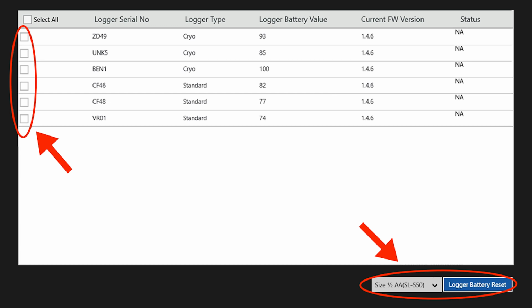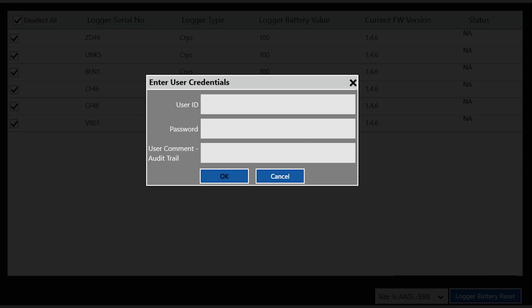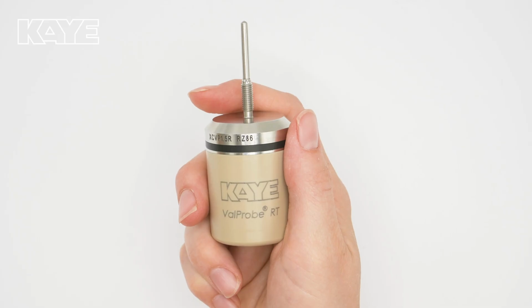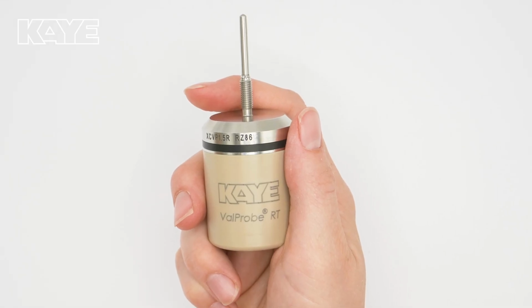If you've installed the half AA batteries into some loggers and the AA batteries into other loggers, you must do this procedure twice, once for each size battery. Then press Logger Battery Reset. Enter your credentials for the audit trail and then press OK. When the batteries reset, you will be taken to a report page that shows that the values have been reset to 100 and the status says Success. Now you're ready to continue using your Kaye ValProbe RT.